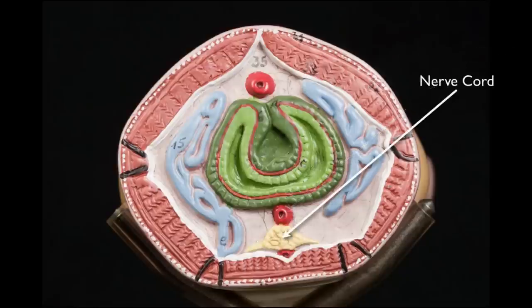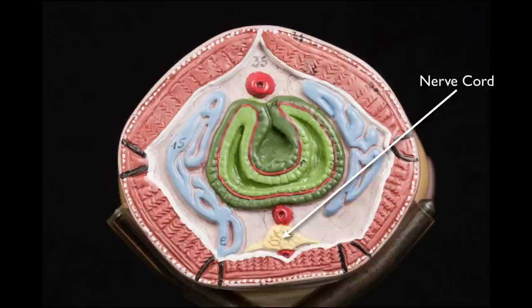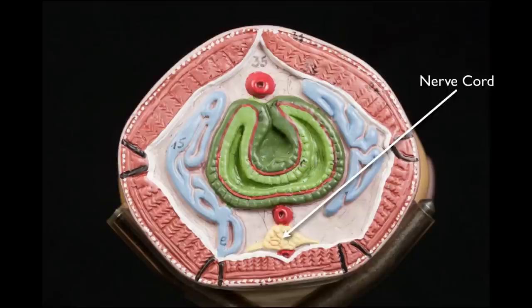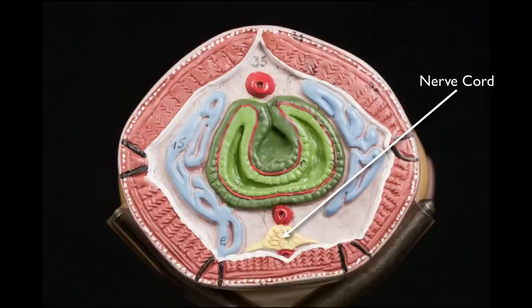Beneath the ventral blood vessel is the nerve cord. Like most invertebrates that have a central nervous system, the nerve cord in annelids is located in the ventral part of the body. As we will see in the Invertebrates III lab exercise, chordates are the only major phylum with a dorsally located nerve cord.